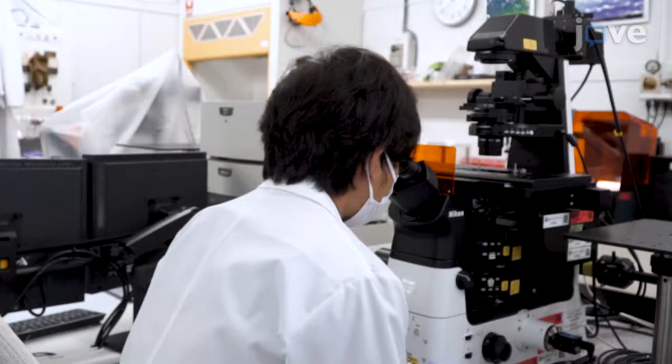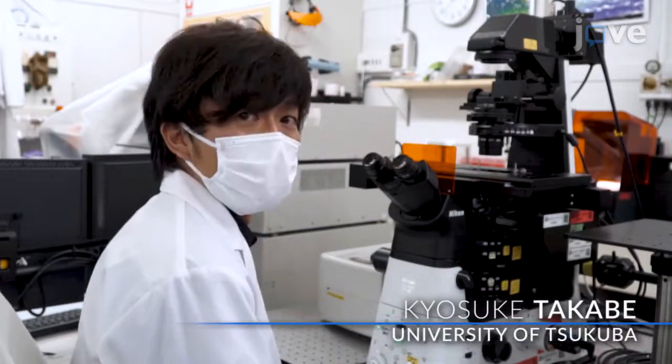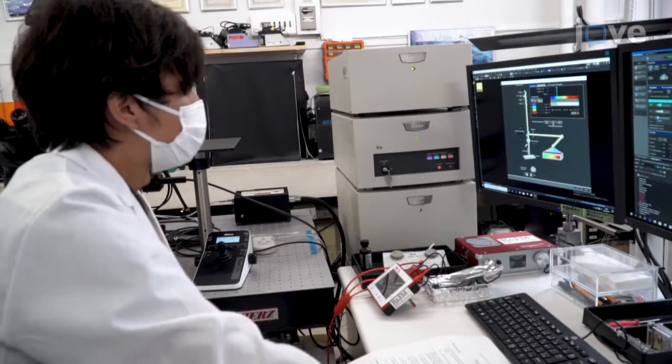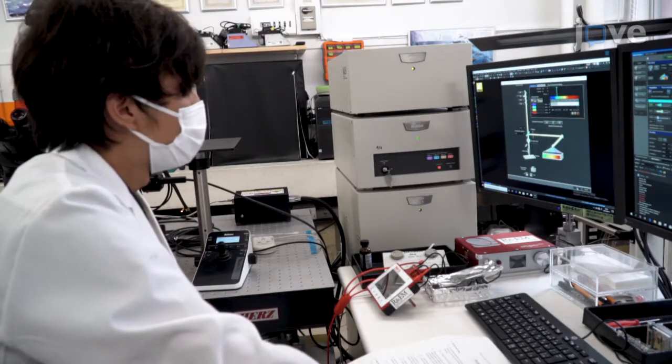Demonstrating the procedure will be Kyousuke Takabe, an assistant professor from my laboratory. For confocal reflection microscopy and multichannel confocal microspectroscopy setup, connect a confocal microscope with descanned spectral channels to a photomultiplier tube.